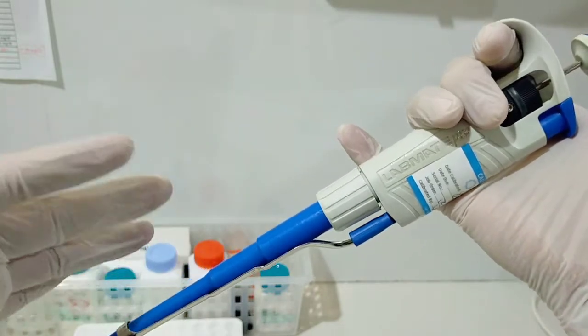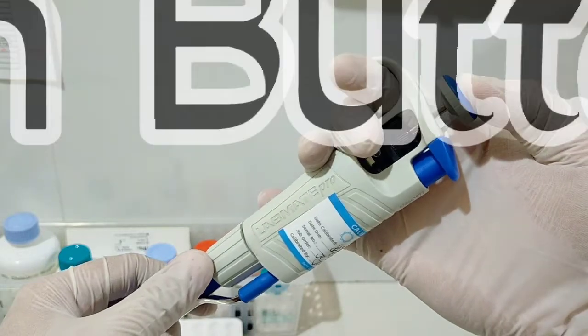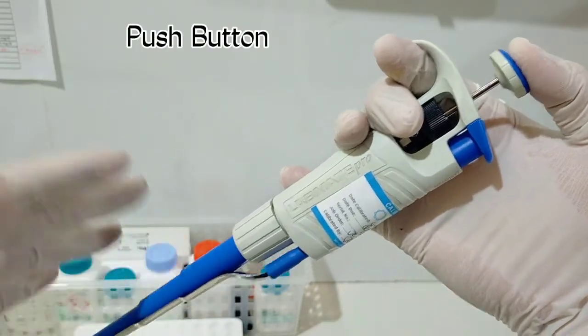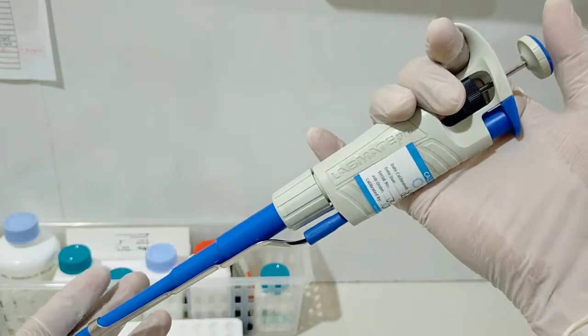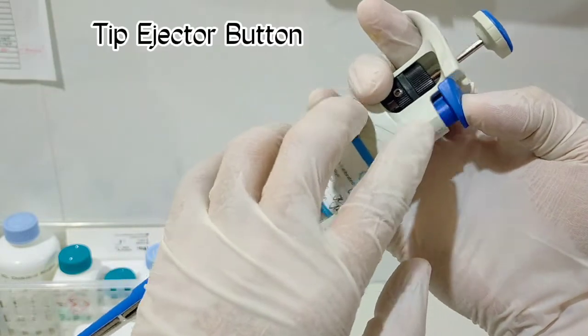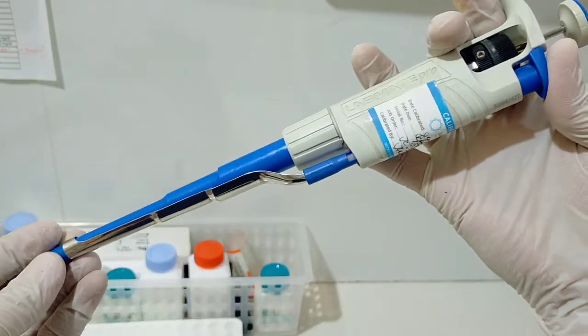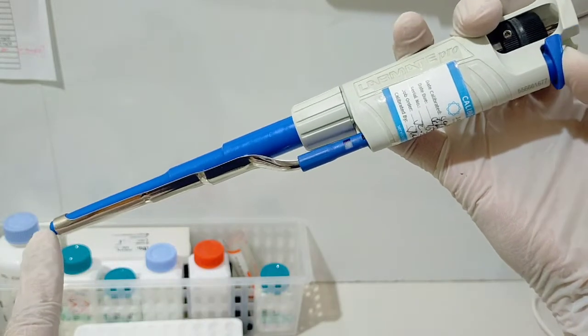This is an air displacement pipette. First is the push button. It is used to dispense or aspirate liquid samples, liquid solutions, or reagents. Next, we have the tip ejector button. You can see here that there is an extension structure coming from the tip ejector button.